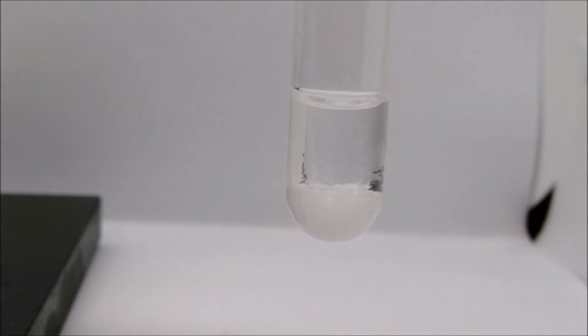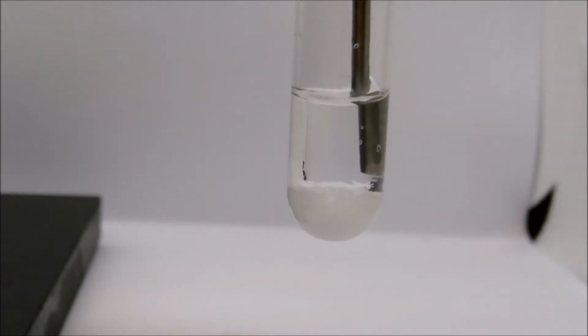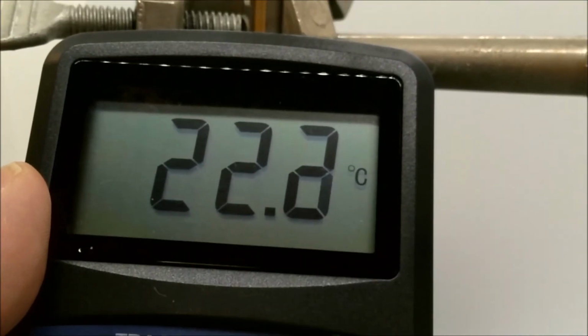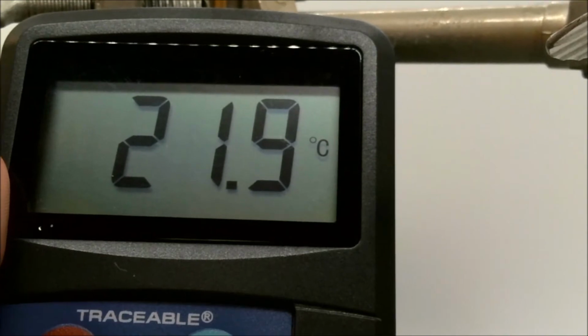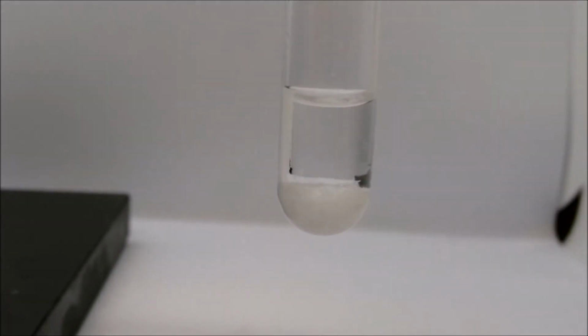There's not a lot of clear evidence yet that a reaction is occurring, but if I check the temperature, if you recall, our room temperature in reaction A was around 24 degrees Celsius. If you look at the temperature of this solution now, we see as the reaction occurs, the temperature is dropping. So that change in temperature is one sign of the chemical reaction.